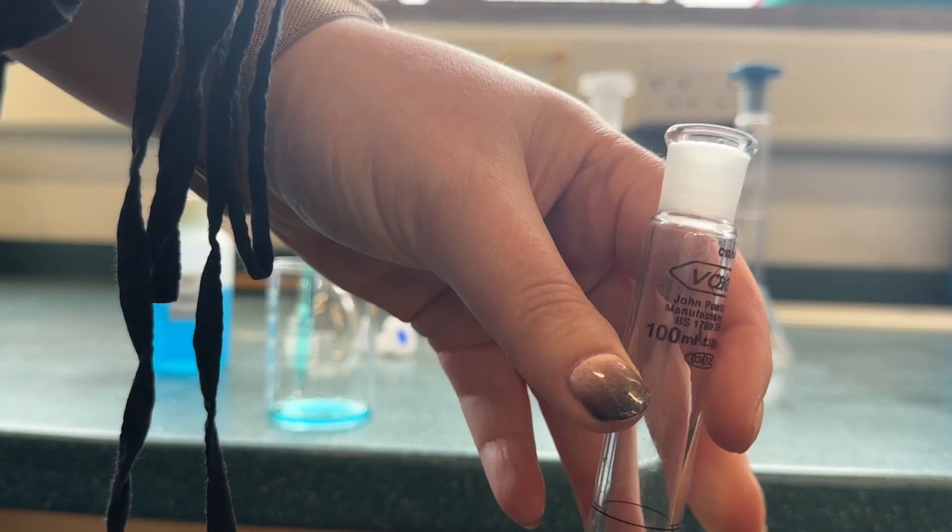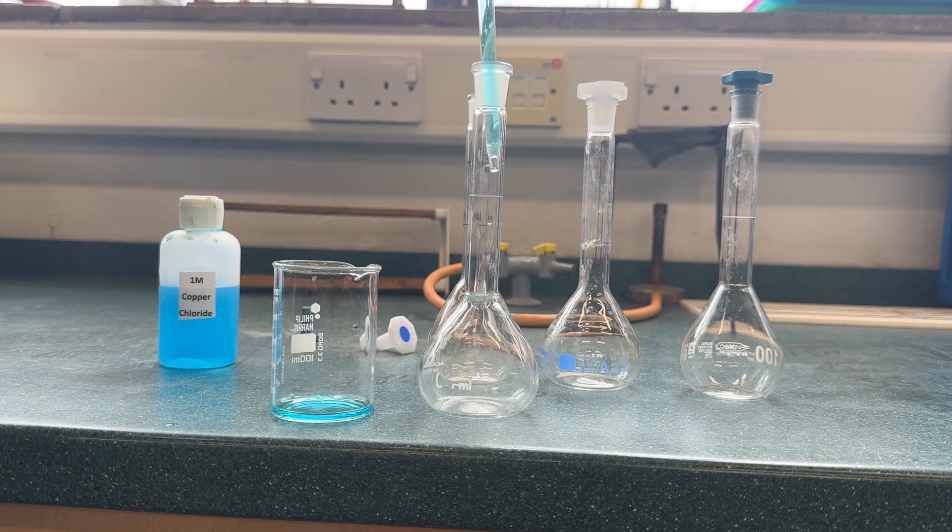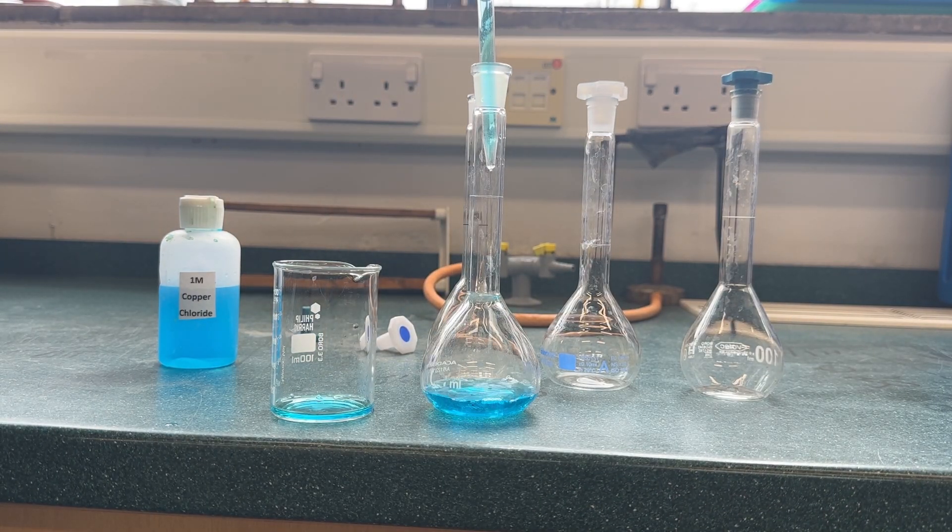As you can see, as the solutions get diluted, the blue color becomes less intense. This is what the colorimeter will measure.